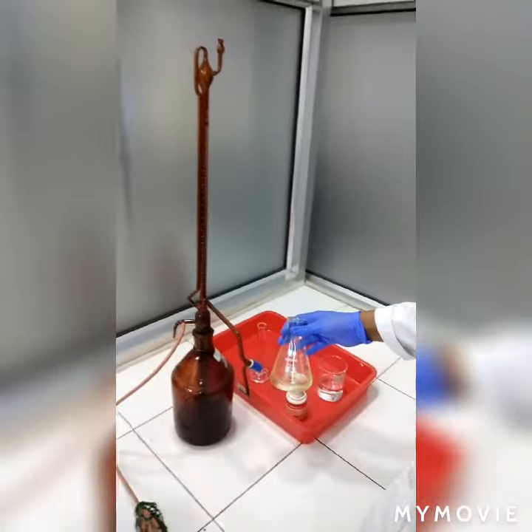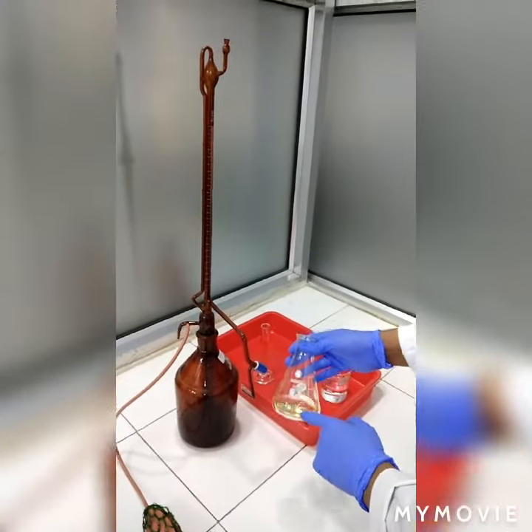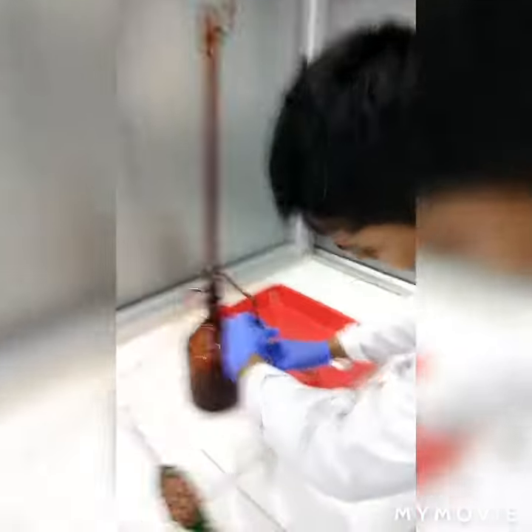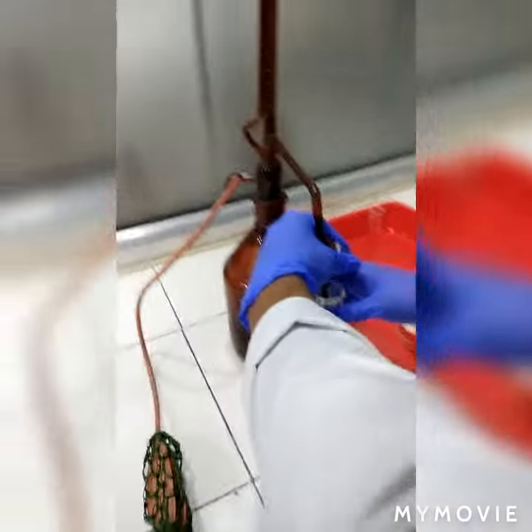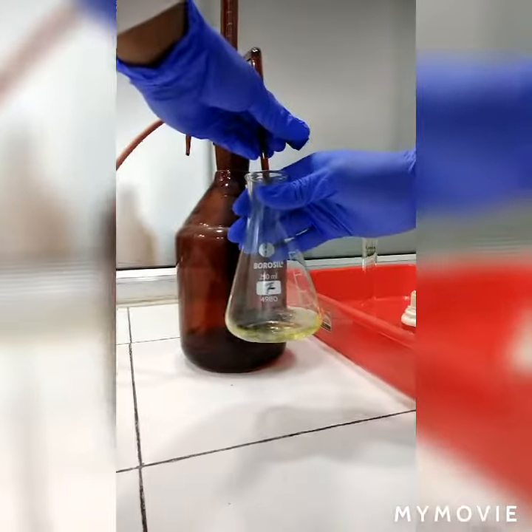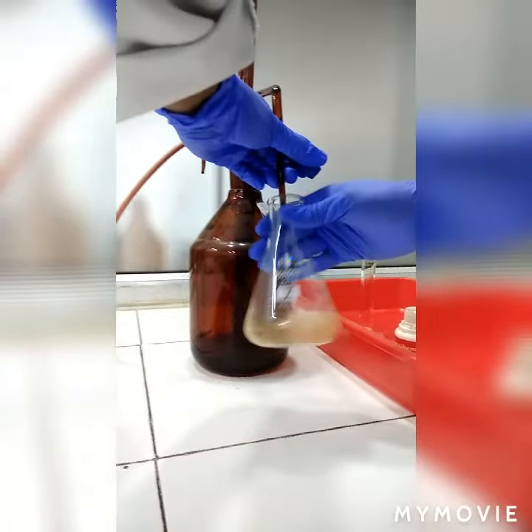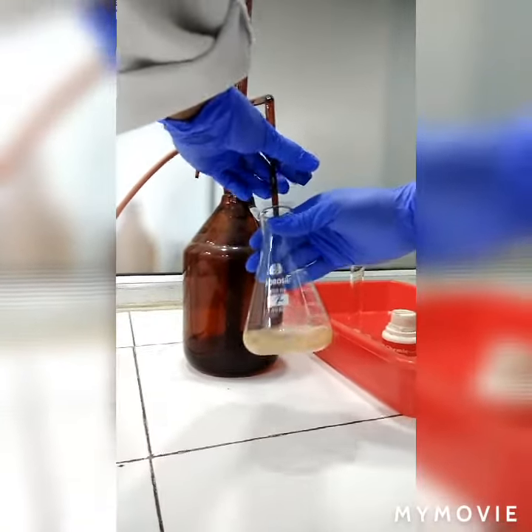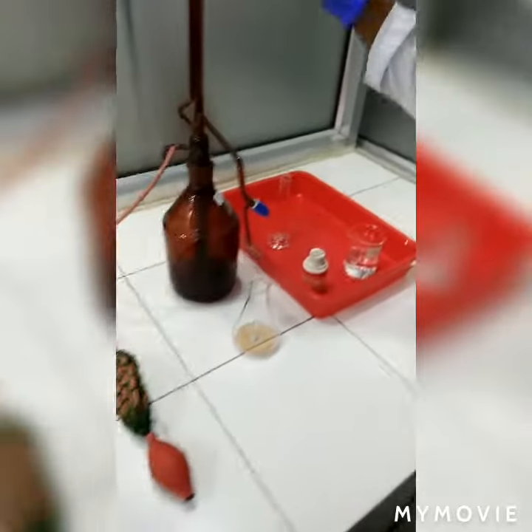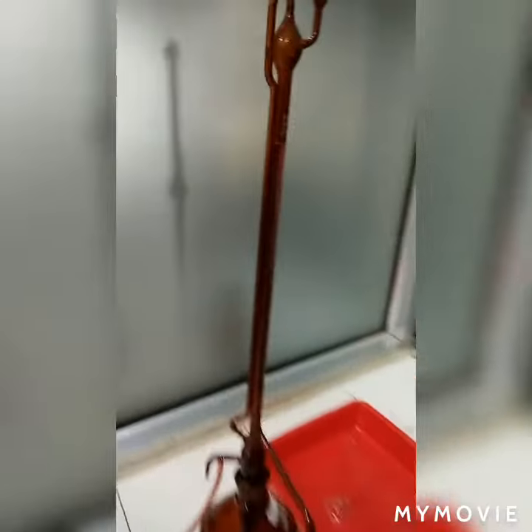So now we have to titrate this. The endpoint is from Pale Yellow to Red. So let's start. This is the endpoint. The reading is 0.5.